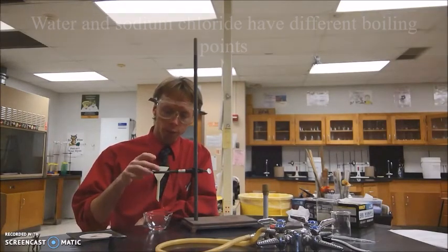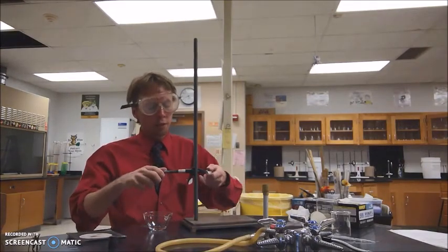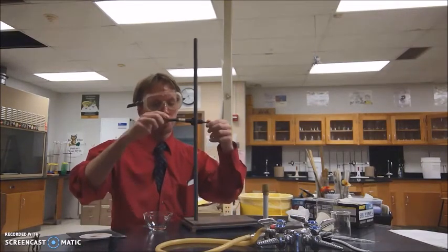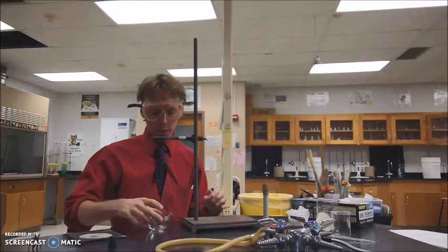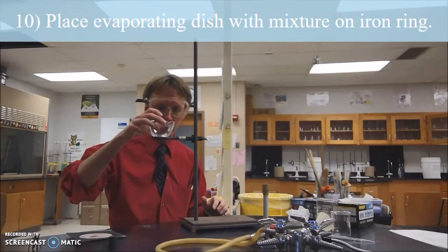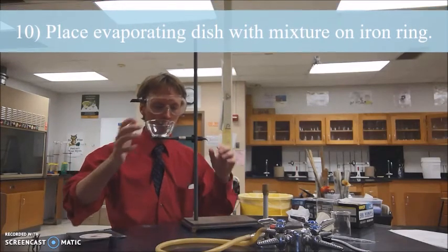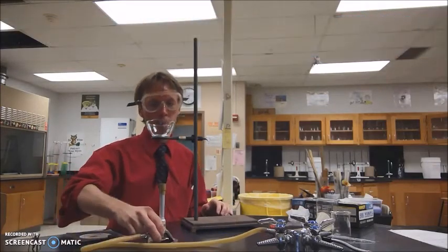To do your distillation, you'll take your funnel off of your filter setup, and you're going to unscrew your iron ring so that you can raise it up a little bit higher. You're going to take your evaporating dish of colorless liquid and put it on top. And we're going to go back to using our Bunsen burner.